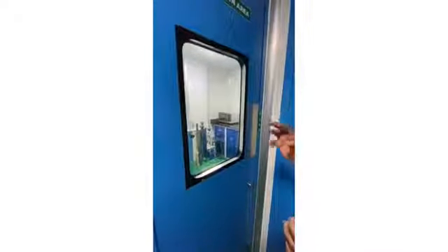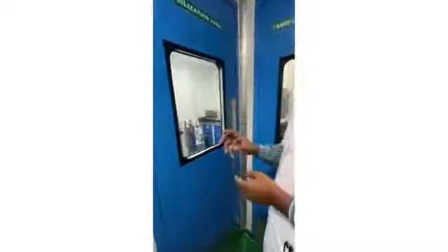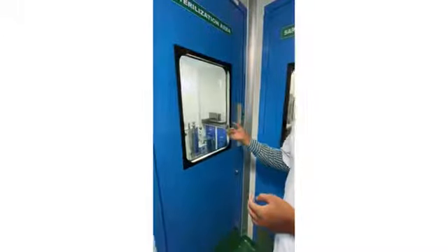We are sterilizing glasswares, media, and all in this sterilization at 121 degrees centigrade, 15 lbs pressure. To kill all the types of microorganisms, what we are using to cultivate the organism of product. What we are getting the product now, in that other contamination should not be there. So that's why we are doing sterilization at 121 degrees centigrade, 15 lbs pressure for 15 minutes.